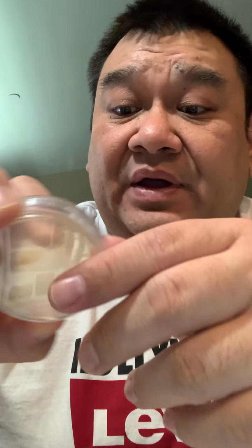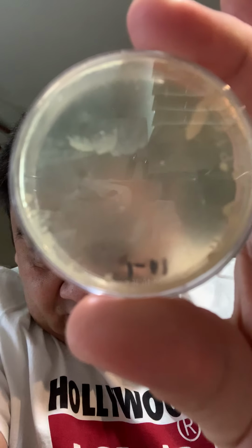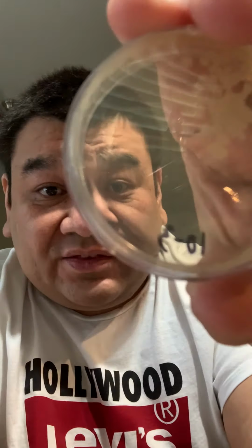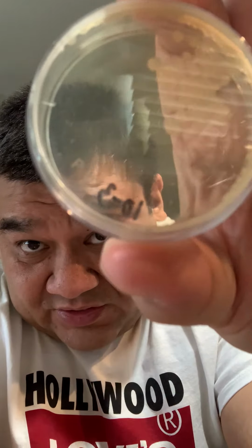The script should explain the results of your experiment. So again, this is my 10^-1. Sorry, the reflection from my computer is bothering me. So these are my results for 10^-1: a lot of growth, a lot of dots. This is my results for 10^-2: a lot of visible dots everywhere, as you could see, besides my face. And then 10^-3: big dots, and a lot of them around the corner of the petri dish.